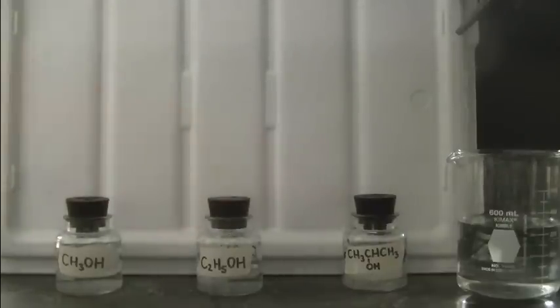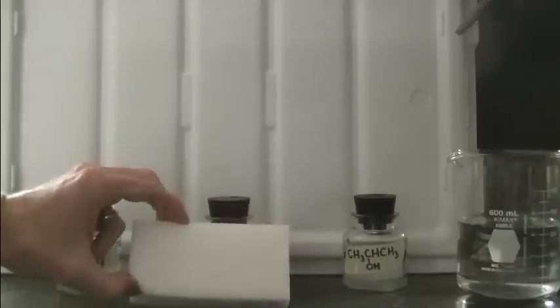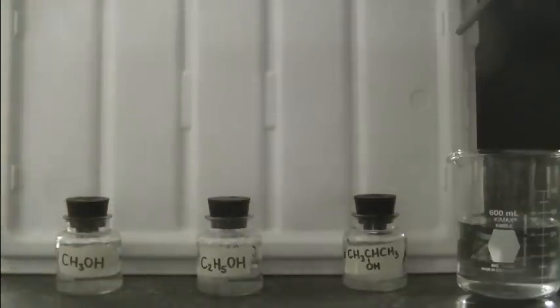In each container I've placed a cut piece of a Mr. Clean magic eraser and that's going to soak up the alcohol and then we'll be able to burn them more easily.